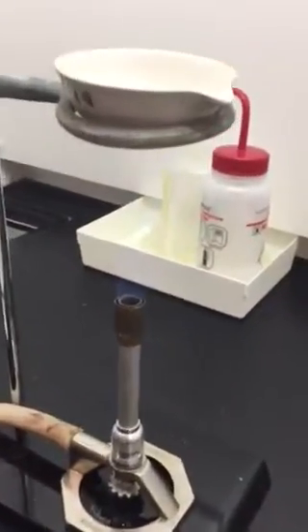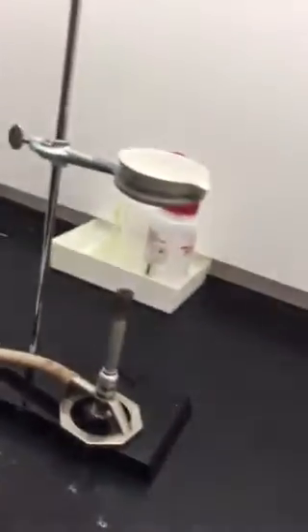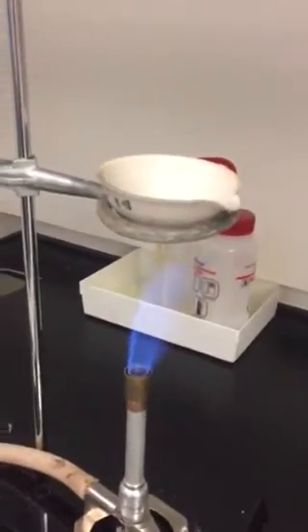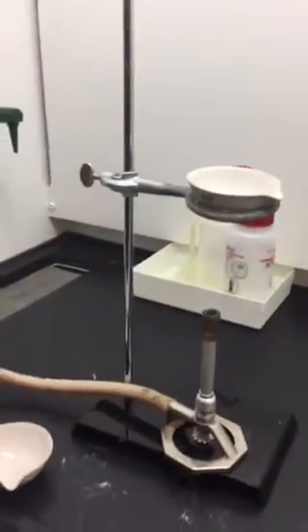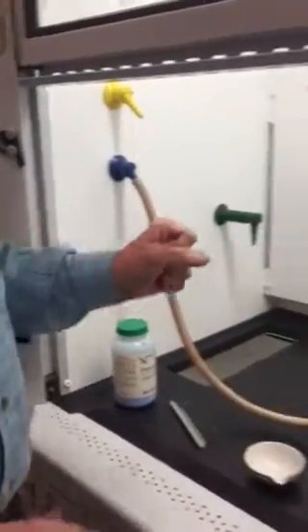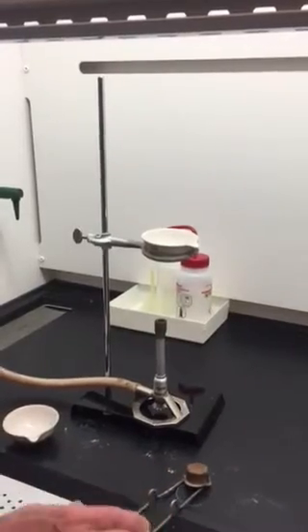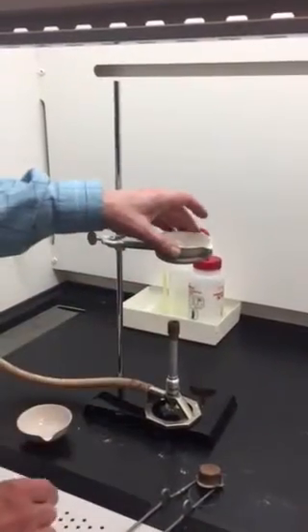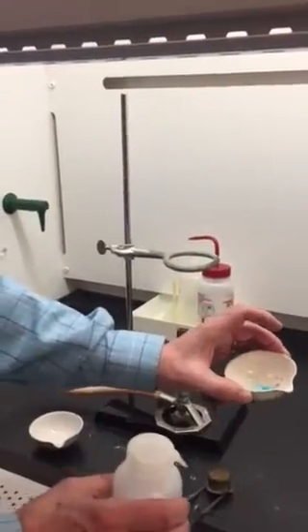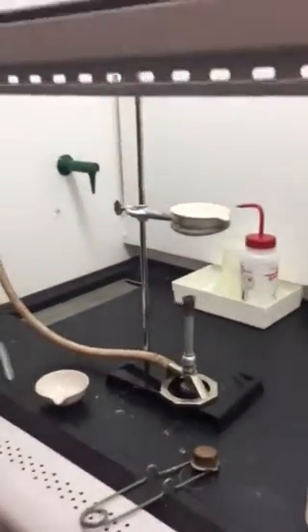There's no reason to get nervous because the fume hood ensures that everything goes out safely. You can probably just barely make out the flame. You're instructed to heat it for 30 to 60 seconds as you observe, then after 60 seconds you'll turn off the gas. You'll have to allow the evaporating dish to cool before we dispose of the material. When you're done, take that evaporating dish and simply add some water back to it, observe what happens, and then use your wash bottle to rinse it into a waste beaker to deal with at the end of the lab.